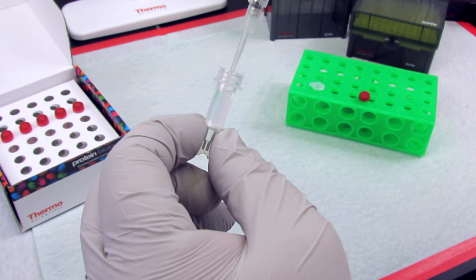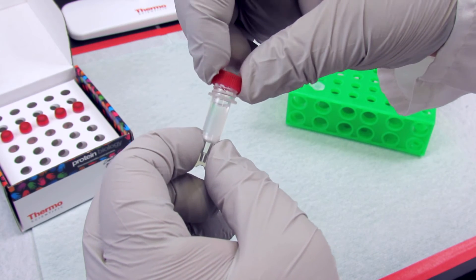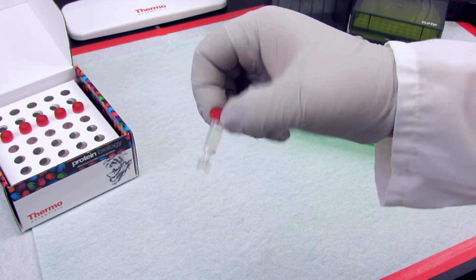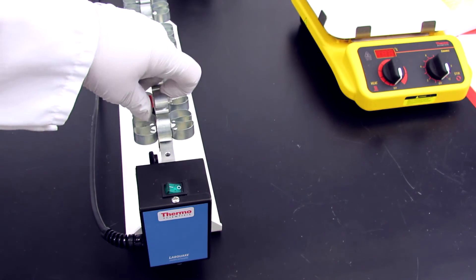After adding the sample, simply cap, re-suspend the slurry, and incubate the column for 40 to 60 minutes.